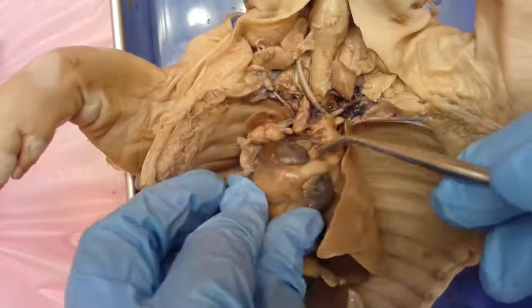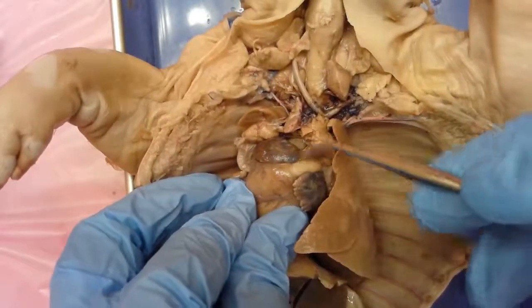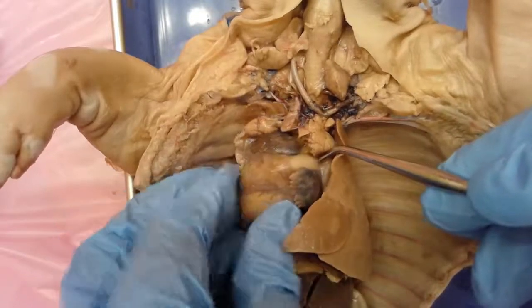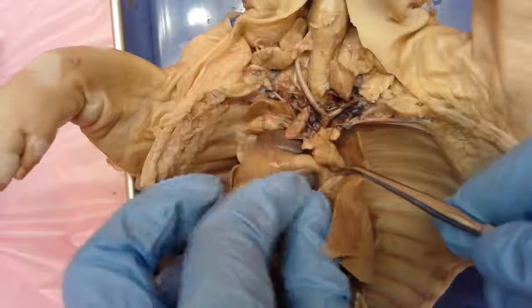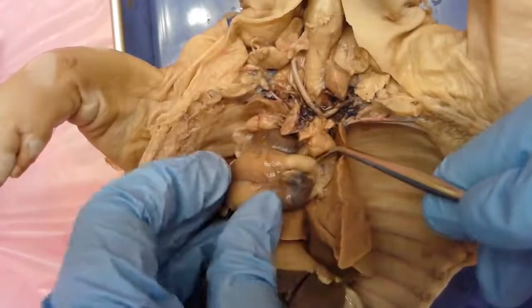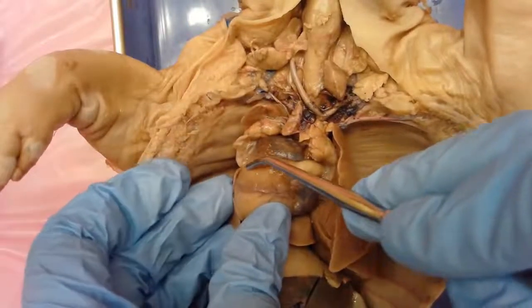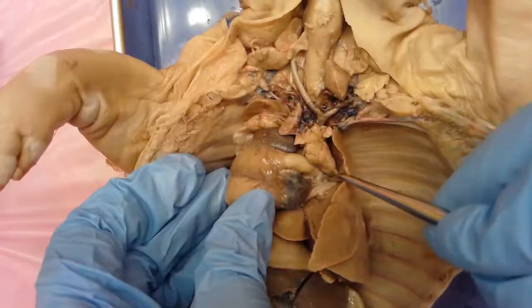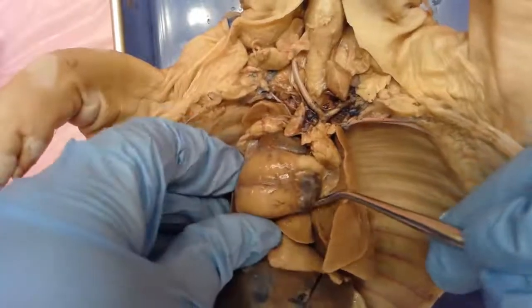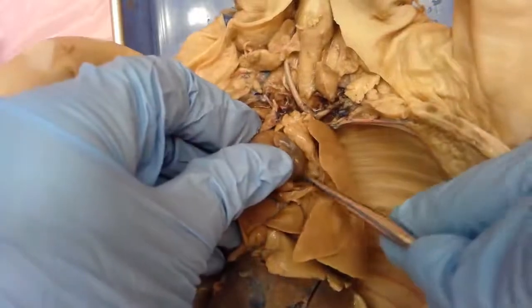One of the other structures you can make out is this white tube that's kind of in the middle of those two atria, and this is the pulmonary artery. The pulmonary artery is actually leading back towards the lungs here — it actually goes into the lungs, and it is carrying deoxygenated blood from the right ventricle. That deoxygenated blood is going into the lungs to pick up oxygen, and it will return back to the left atrium through blood vessels that are back here.